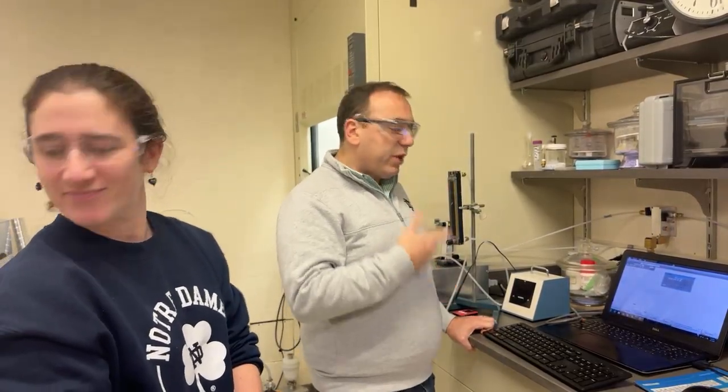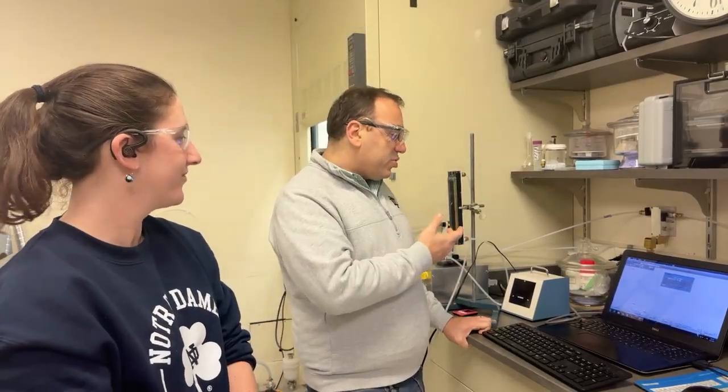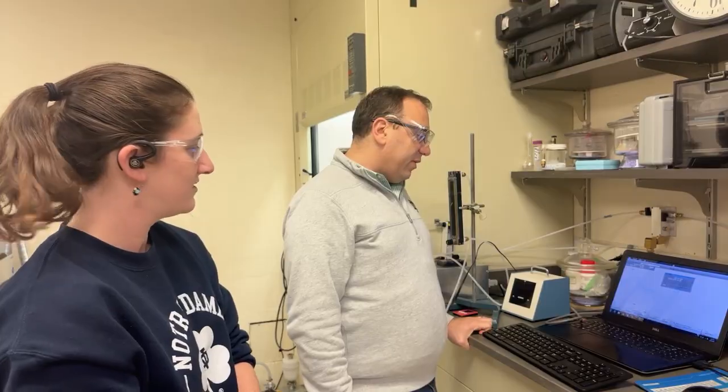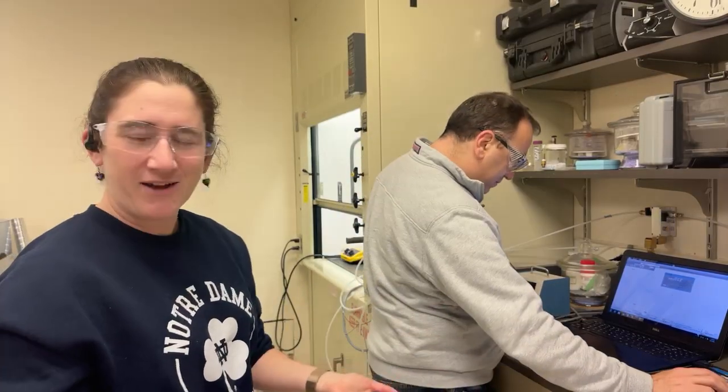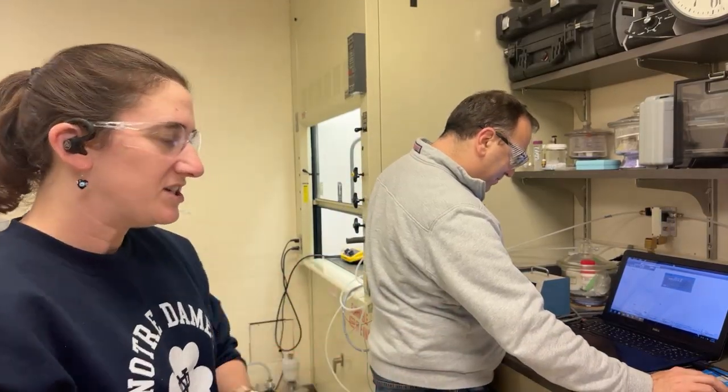We can do calibration, so we know that the amount of, let's say, lead is X%, so we could do a calibration curve, and based on that, we can even quantify. But just based on these peak intensities, those are very small quantities. Okay, so there's some lead. Maybe it's a safe amount, maybe not. To figure that out, we would have to do some more detailed testing. I think for now I'll play it on the safe side.